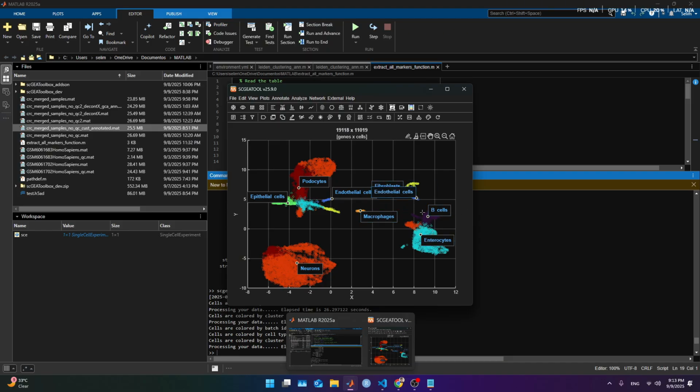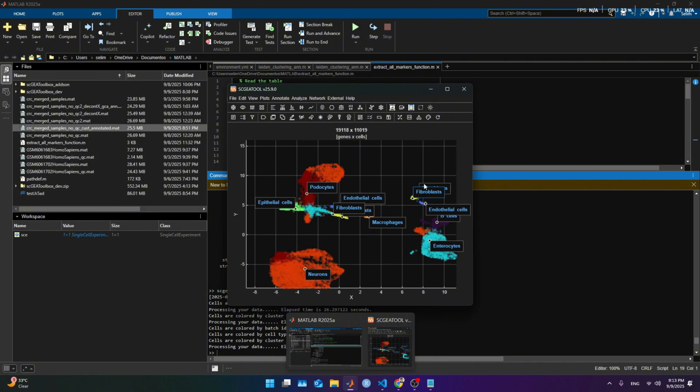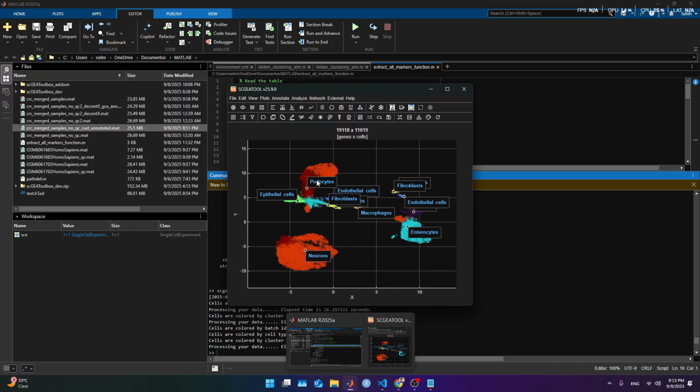enterocytes, fibroblast, these endothelial cells, endothelial here, fibroblast here as well. These are two different types of fibroblast, so we will have to find the markers for the second population here, and the epithelial here, and the enterocytes. What's the difference between these two? And that's it. Podocytes, that's potentially the cells we couldn't identify here, or we didn't even have neuron markers here, so that's probably the unknown population, but those are not neurons, they are something else, and we have to figure out the markers by, again, brush mark the expression and find what that could be.